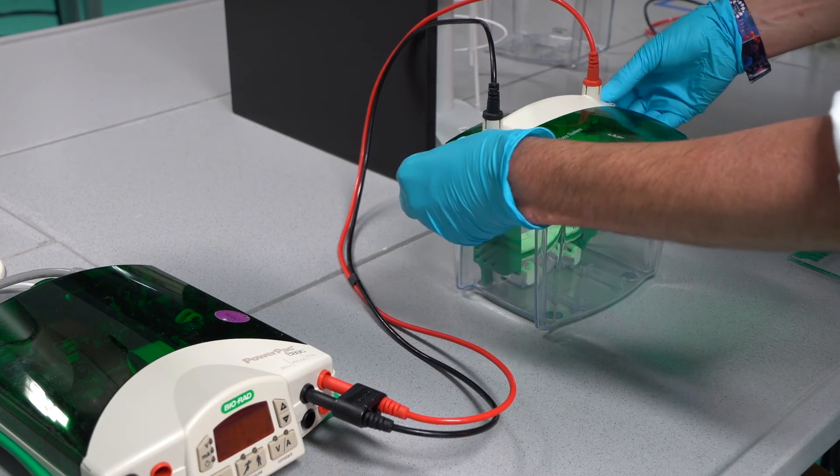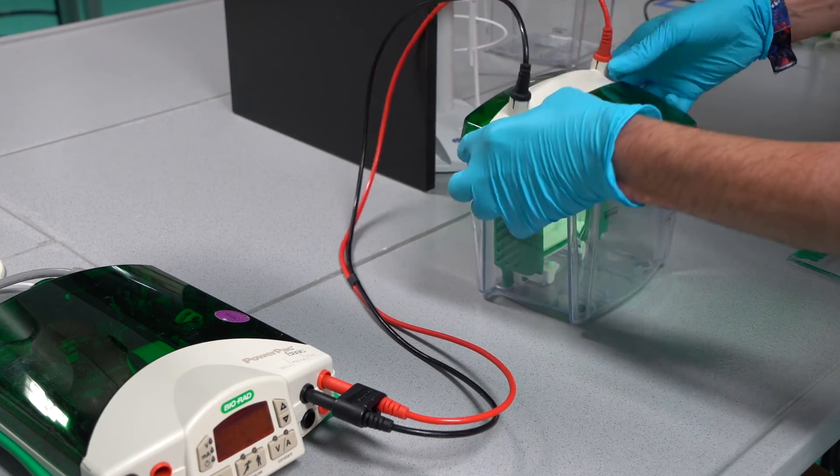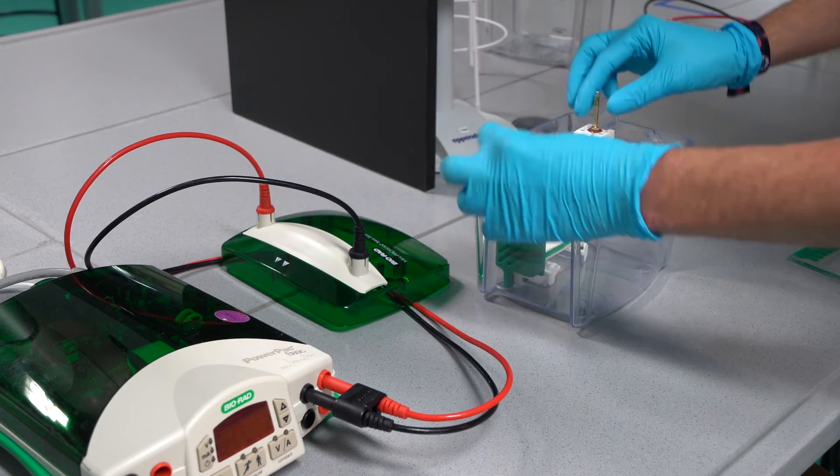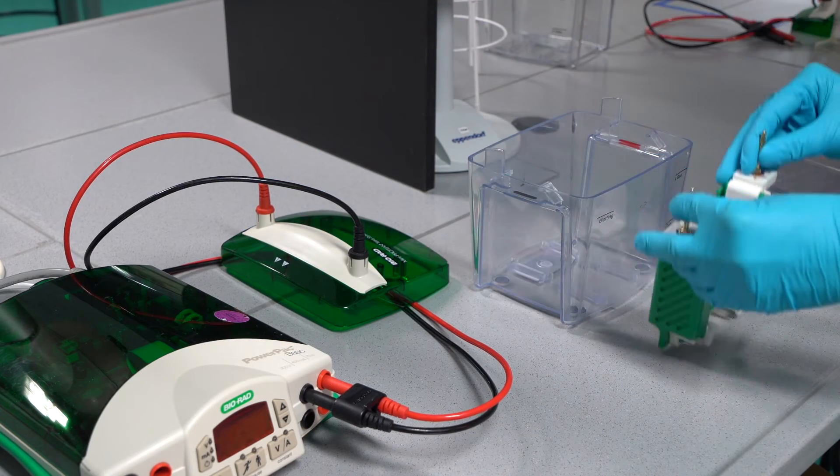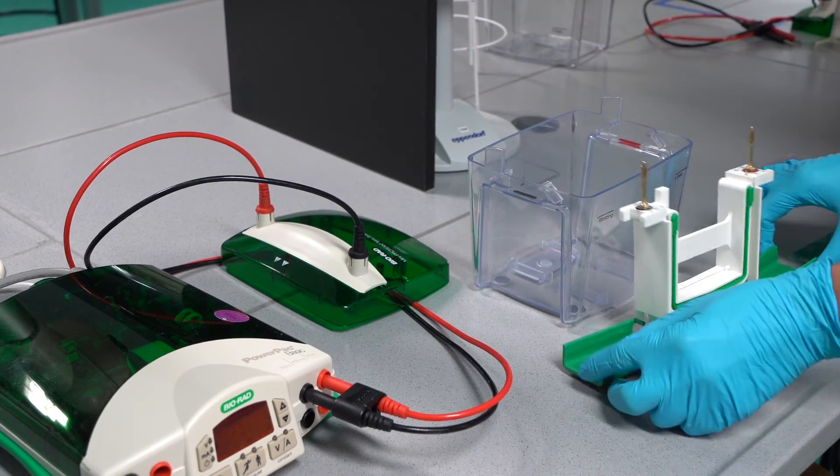The gel can now be placed on the electrophoresis frame. To close the frame on the other side, you will need a buffer dam. If you use two gels in the same frame, you do not need this dam.